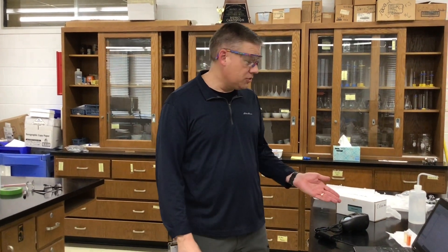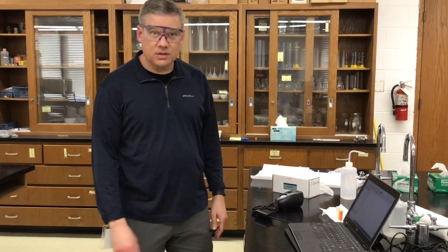Hello, this is Mr. Hood. We're doing the equilibrium lab of iron plus thiocyanate which makes a red solution. So we're going to use the colorimeter to find the color of these solutions.